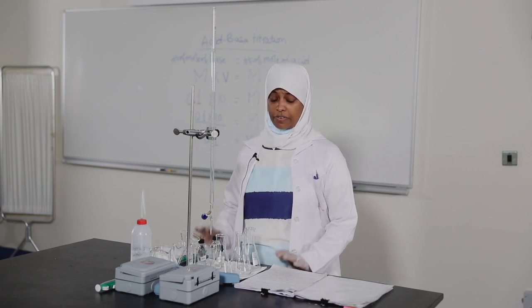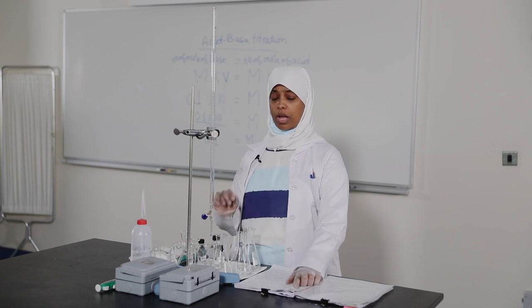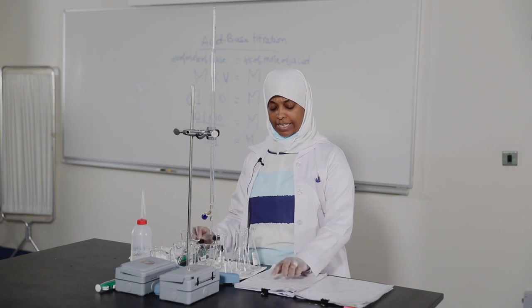Titration is an analytical procedure that allows us to measure the amount of one solution needed to react exactly with the contents of a standard solution.